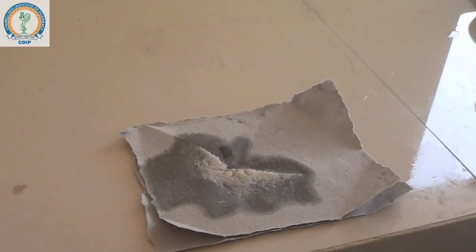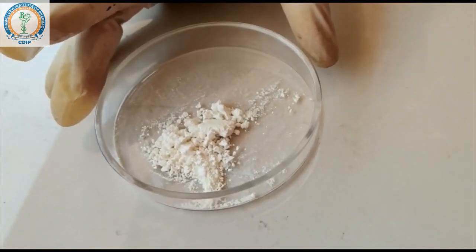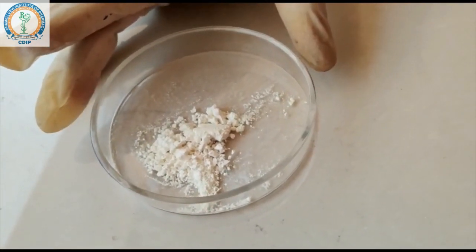After the filtration, you can see the filtered benzocaine. After drying, you can get the powdered form of the product.